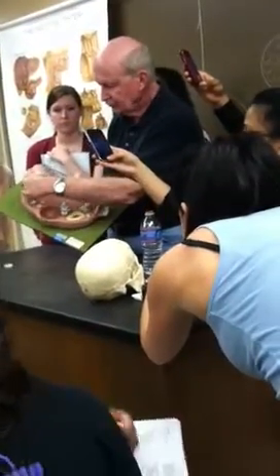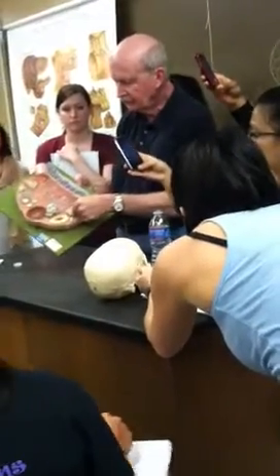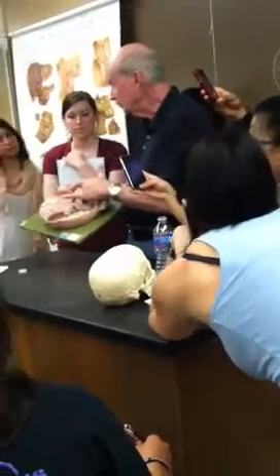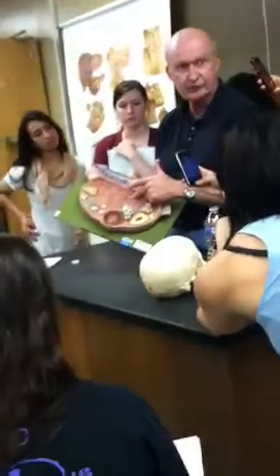And we divide them into the cortex, that's out here, that has your different follicle stages in it, and then the deeper tissue would be the medulla. And that's where the big blood vessels are.